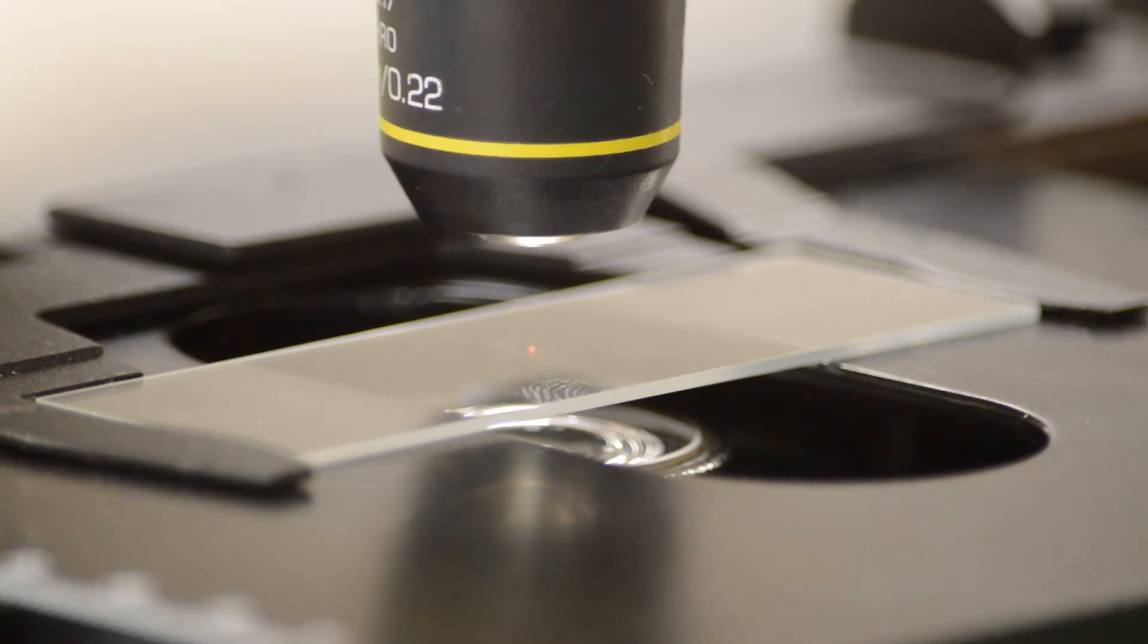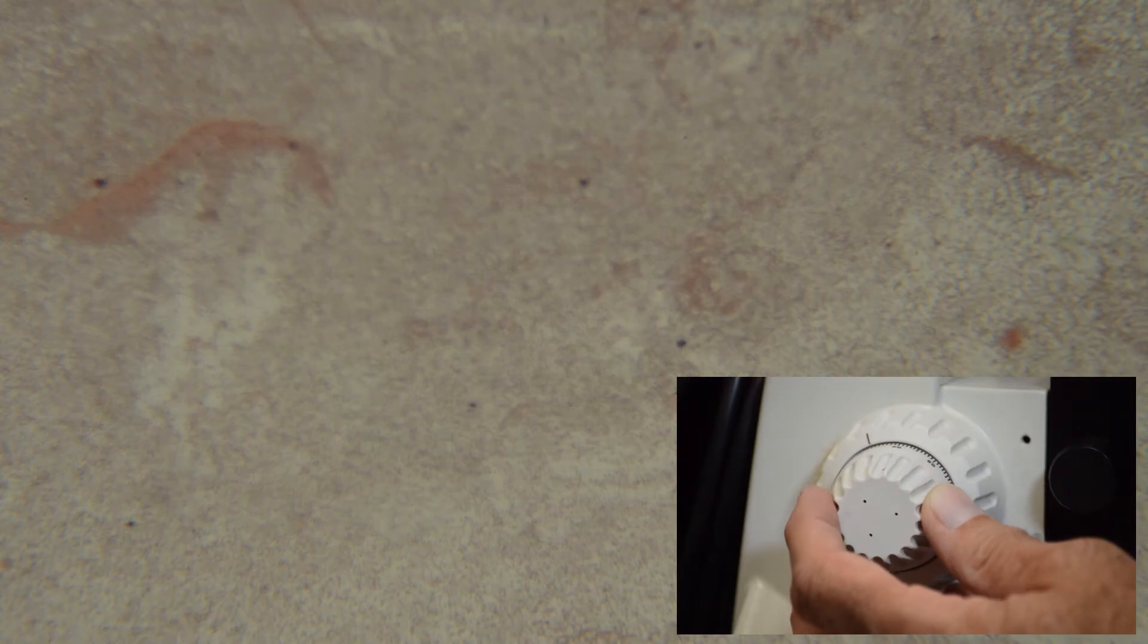You should not have to move the specimen much at this point. It may take a little bit of movement to make sure that it's centered. You then take your fine focusing knob and again as we look through this we can focus this in and get this focused.